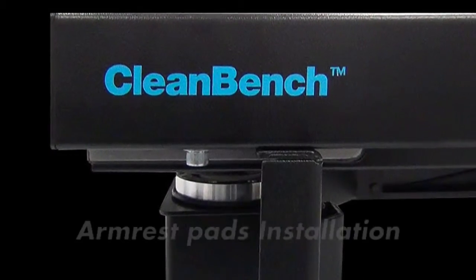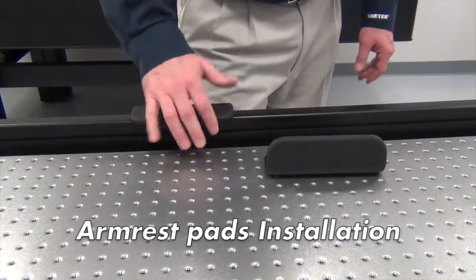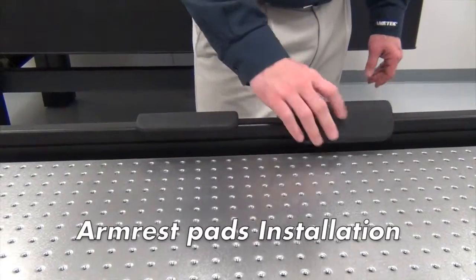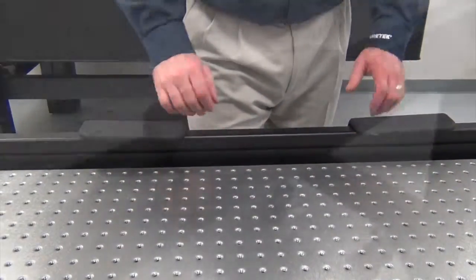The armrest pads can now be installed along the front support bar. Place anywhere along the length and slide into position.